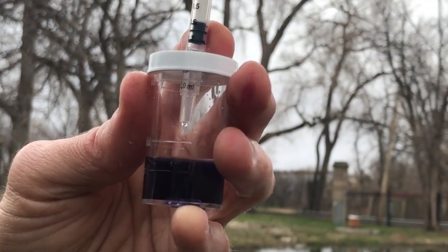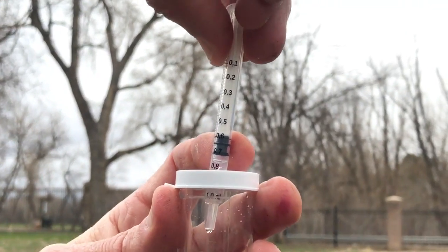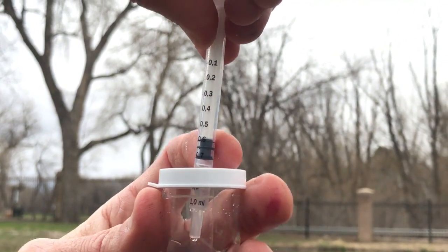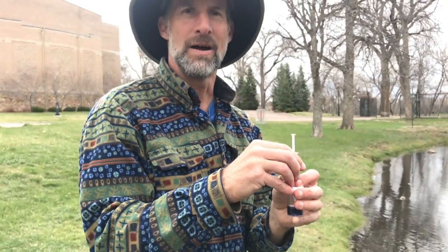Okay. And that is right here. That is about 0.61 milliliters of our titration solution. And we're again going to multiply that by 300 to get our parts per million of calcium and magnesium ions. So that's parts per million of water hardness. 0.61 times 300. So our last test is one of overall water quality.